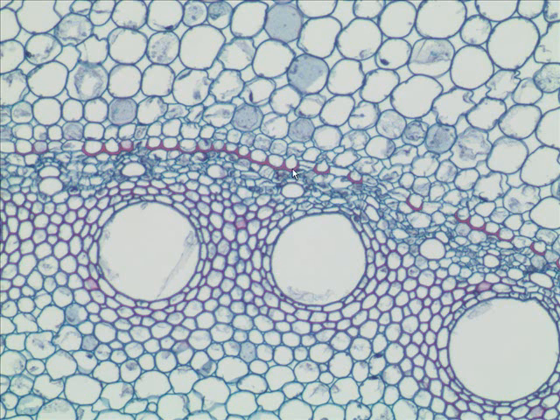What do we have here? Well, this is what out here? This is what type of tissue? Parenchyma, and what position? What's the positional term? Cortex. Now we're moving to the center, but we have these various important layers. There's this one here. We'll take a closer look in a second, but you can see it's kind of coated with a substance. What is that? Well, it's called suberin. It's the stuff that bark is made of.